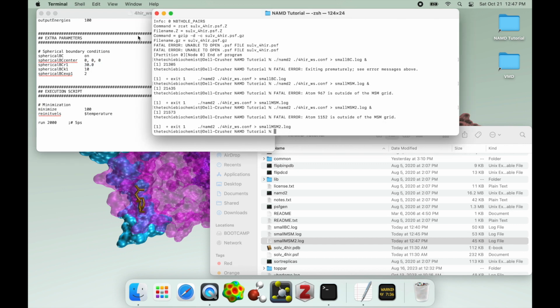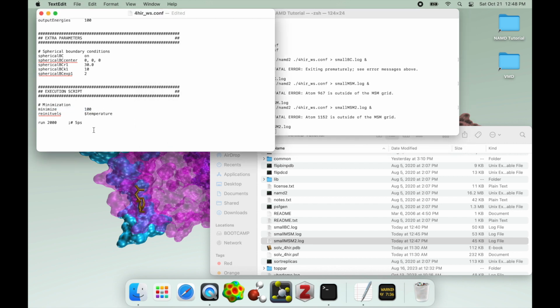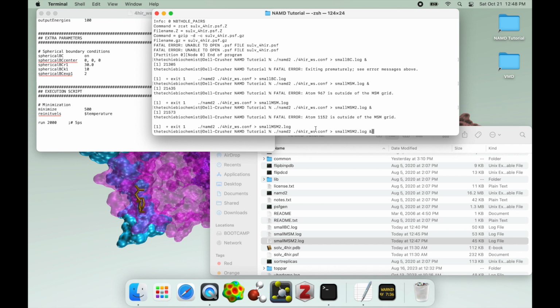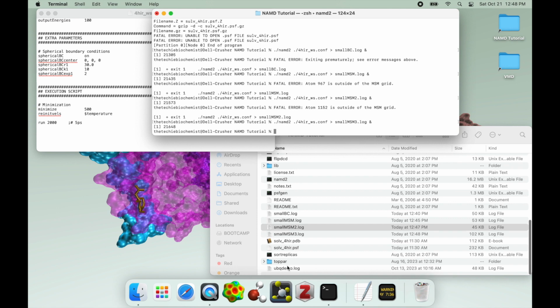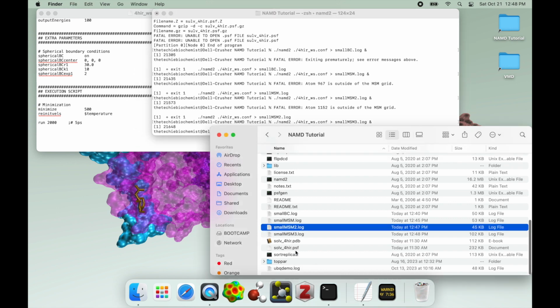The other thing is that you can potentially further delay MSM errors by increasing the number of minimization steps. If I were to increase these minimization steps to say 500, even if we keep the MSM at 10, we'll probably get closer to like 500 or 1,000 steps in. So I'm just going to show that. This is just kind of a probabilities game, so there's no guarantee of it, but I'm going to bet that we are going to get more than 200 actual steps in, because that's essentially what we hit last time. The first 100 steps were minimization, and then it basically did 200 actual steps of running before it hit the atom outside of grid error.